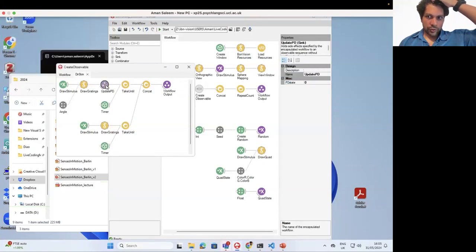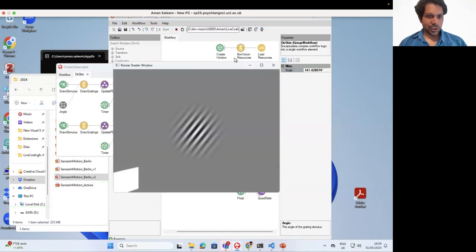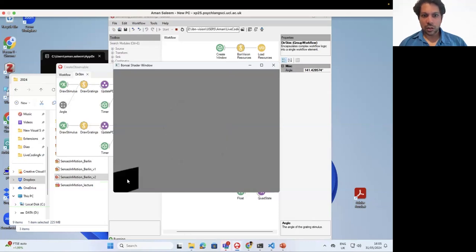Okay, so now we've got this one. It's here, we've got this. I'm just going to copy it here. So here, when it's there, we want this to be 1, and when it comes here, we want it to go to 0. Let's hope this works. Yeah, it's doing exactly that. So it goes to 1 when the stimulus is on, and it goes to black when the stimulus is off.